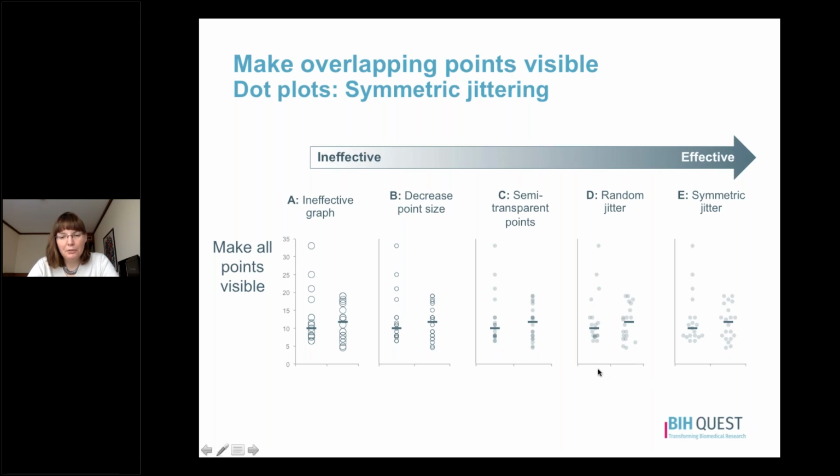It's important to remember here that these x-axis variables are categories or groups. So this is not a measured value of continuous data. With random jittering, we simply spread out the data points a little bit along this x-axis or grouping variable. We do that by adding some random noise. You can see here that this reduces the amount of overlap. It won't eliminate it completely because there's some randomness to what points get assigned which values, and some of them will end up on top of each other, especially if you have a lot of data points, but it does make things a little bit clearer.